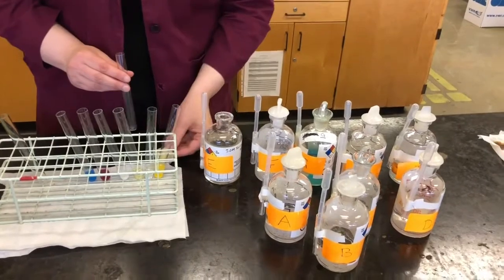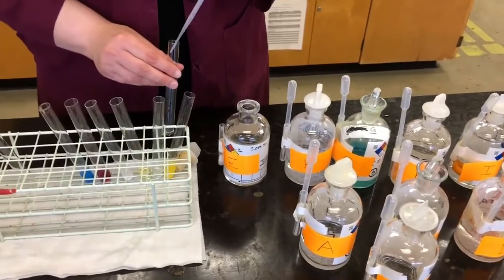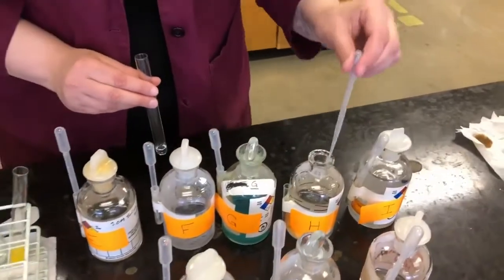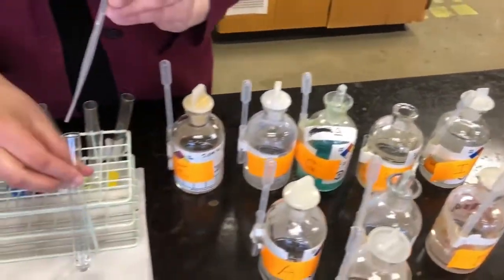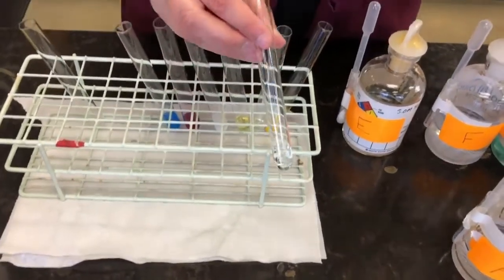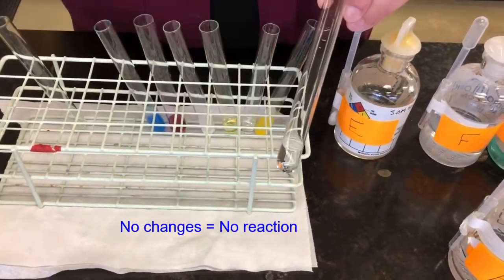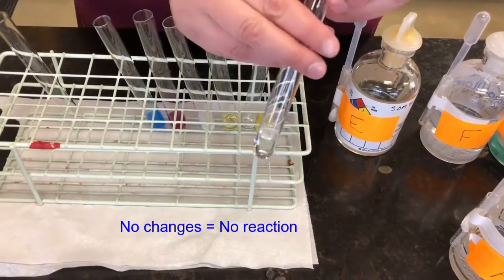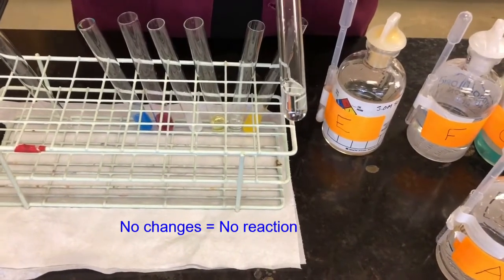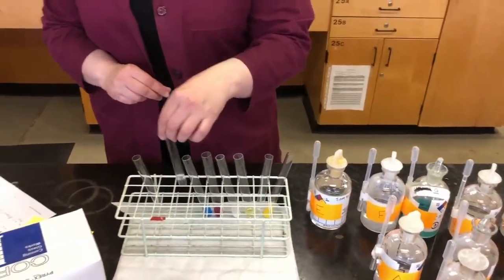So the next one we're going to do is E and H. So we take E again, which again is a clear colorless solution, and H. And again, we see no color change, no solid, no heat, no bubbles, no odor, so no change. So we can conclude based on our observations that there is no reaction here between E and H.